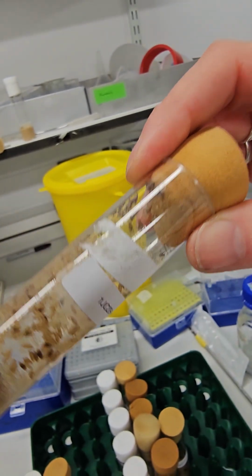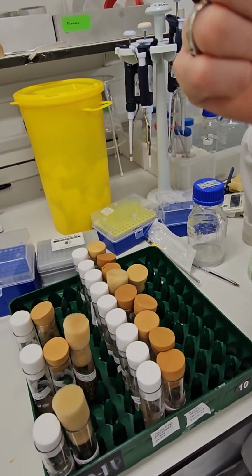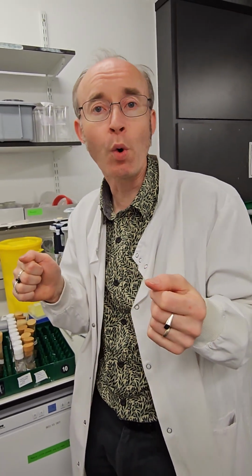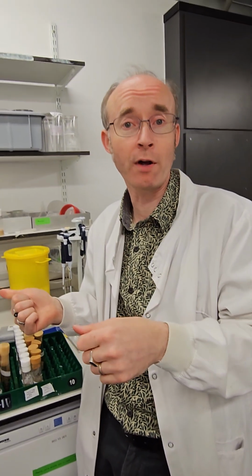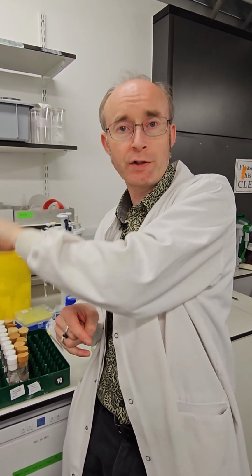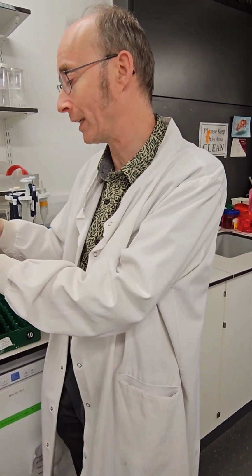And that helps us when we're tracking flies across generations, because we know through all of those experiments that Mendel did with his peas, and then Morgan did 100 years ago with the flies, that you can track chromosomes across generations. So that theory of heredity says that there are particular genes on what we now know are particular chromosomes, and they move through generations together. So okay. That way we know what's on each of these chromosomes.